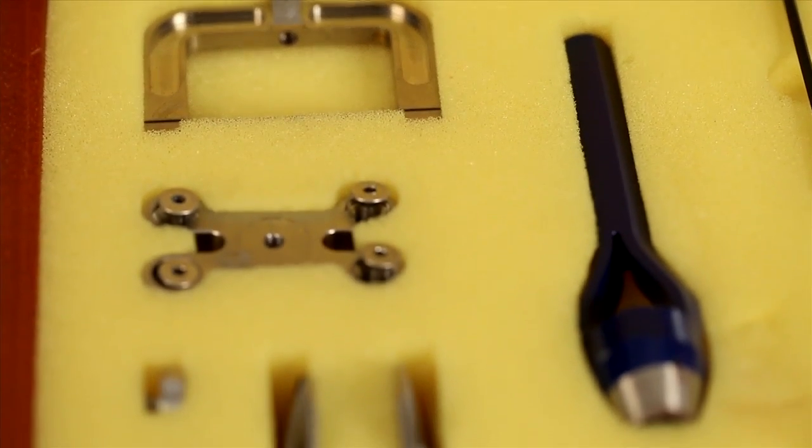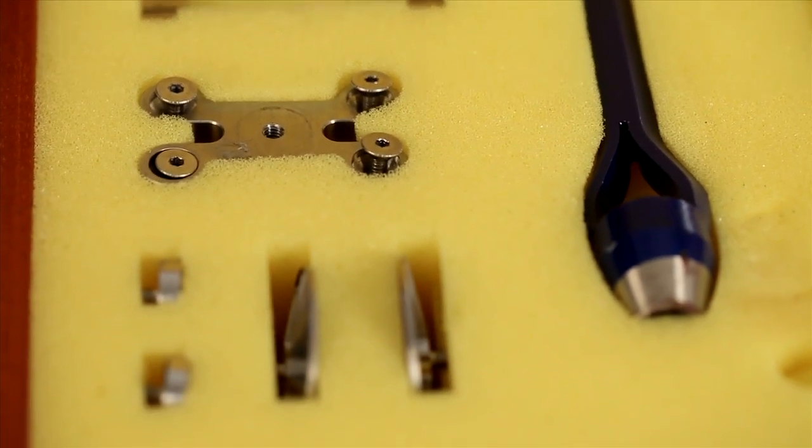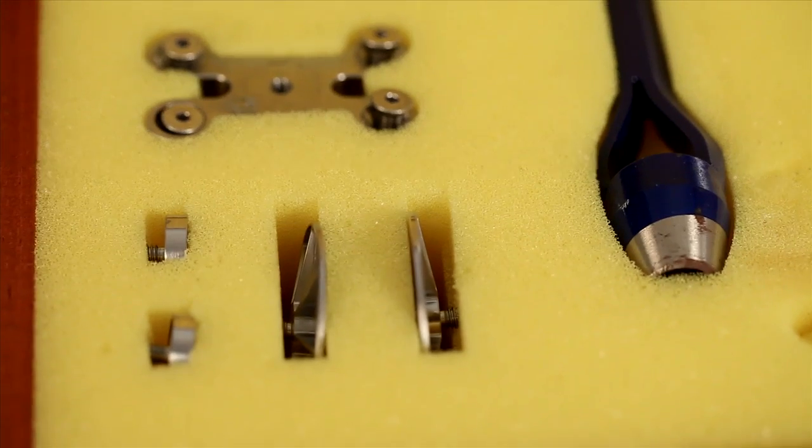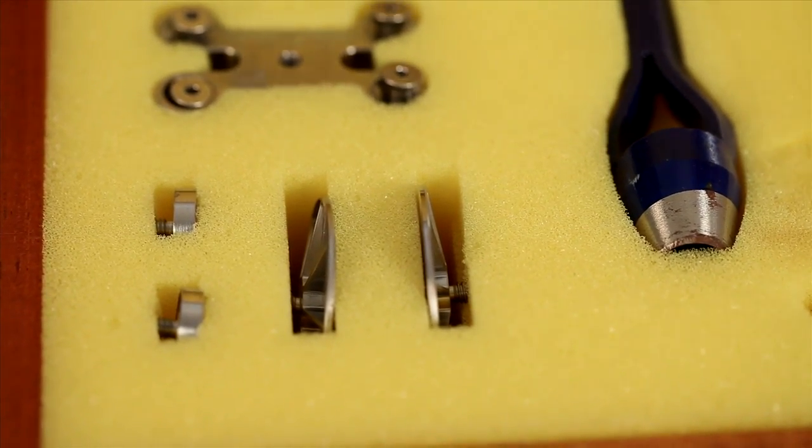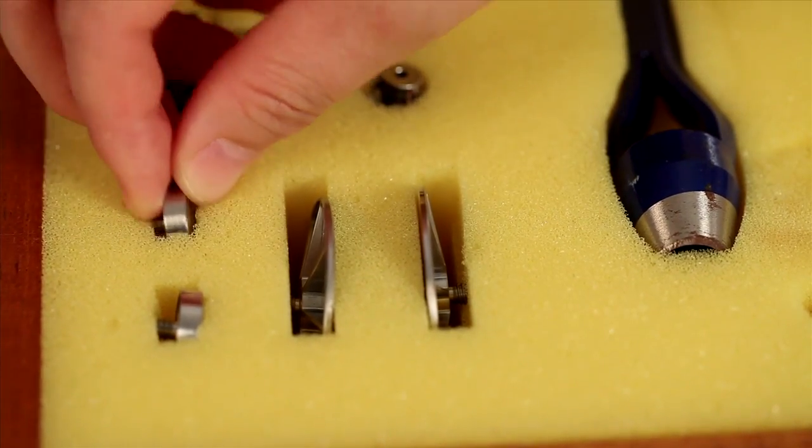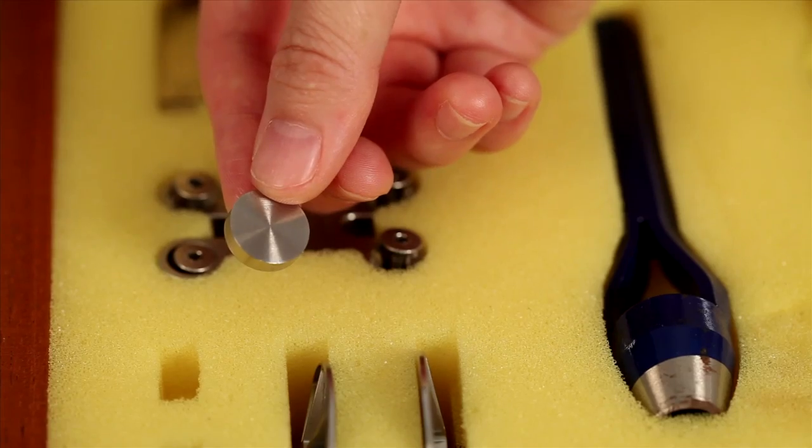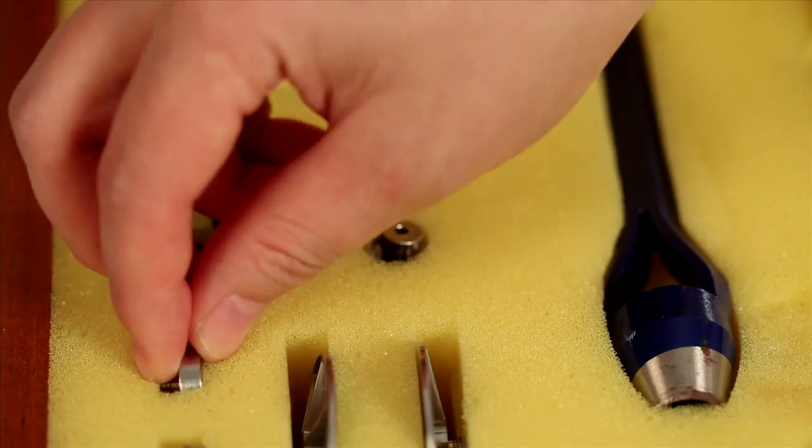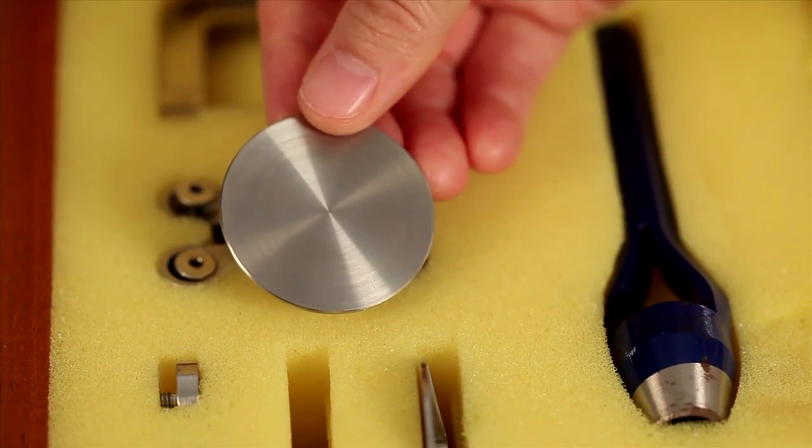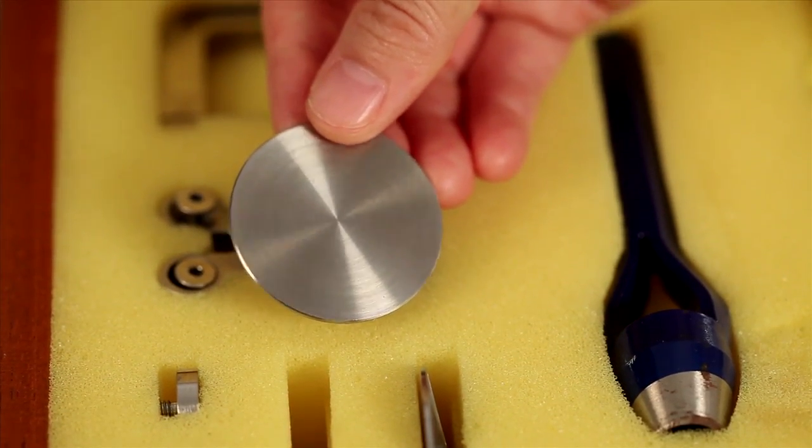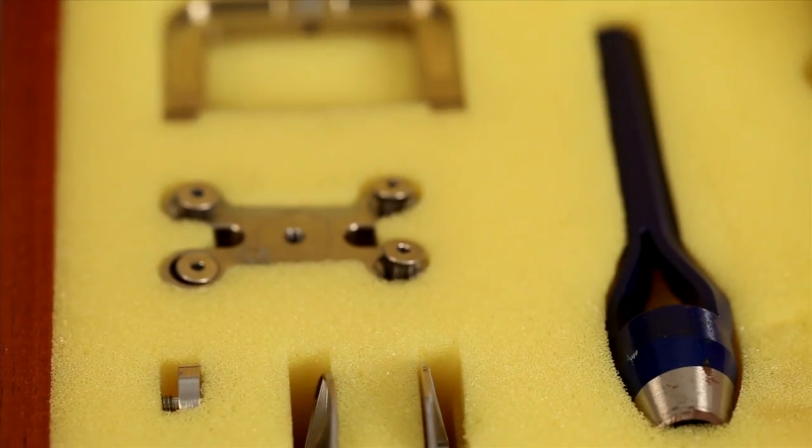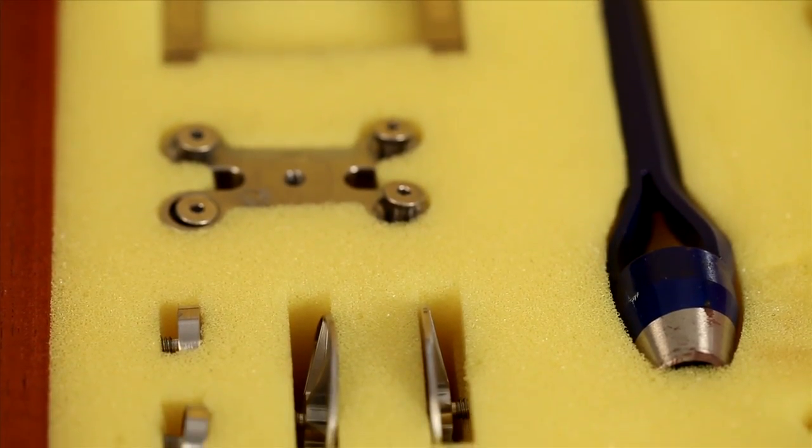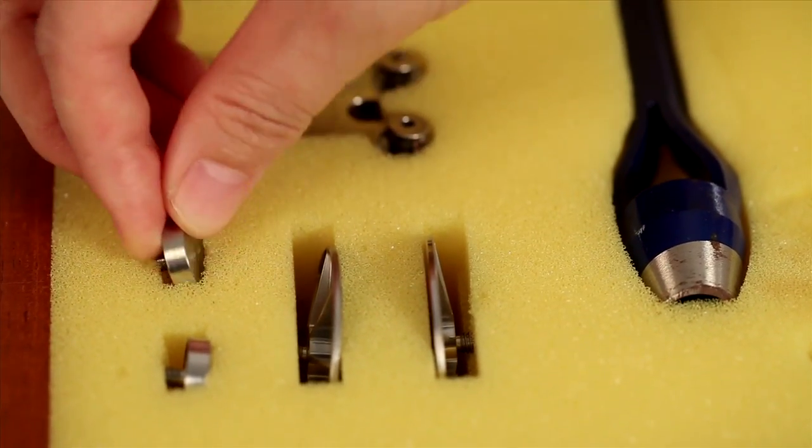TA Instruments offers two sizes of compression clamps in one single kit. They are 15 mm in diameter and 40 mm in diameter. Before calibrating a compression clamp, we shall first choose the appropriate diameter plate.